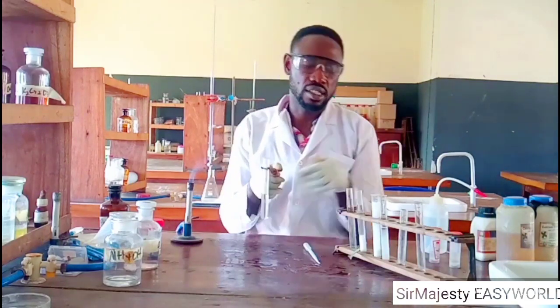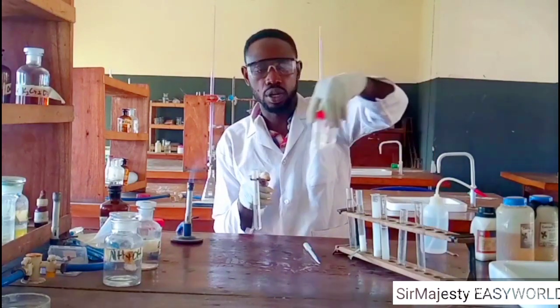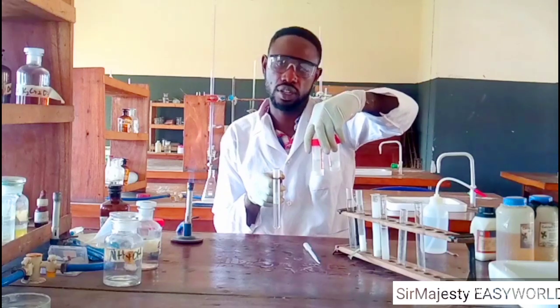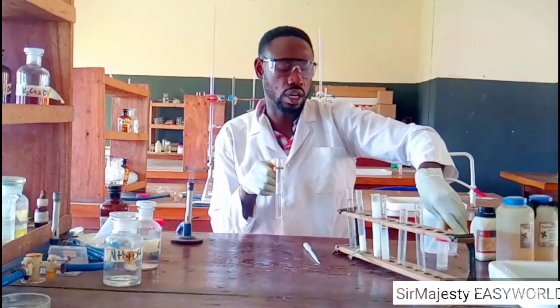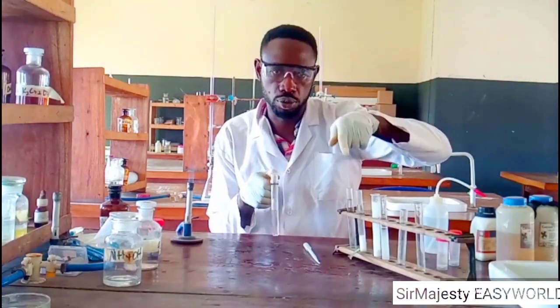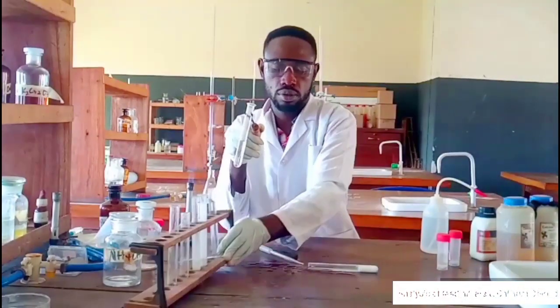So remember, this is the same result you will get when you are asked to mix solutions L and E, that's solutions calcium chloride and solution lead 2 trioxonitrate 5. There will be double decomposition, and the insoluble product formed is called lead 2 chloride, and it is soluble in hot water but insoluble in cold water. So proceed to the next possible thing.